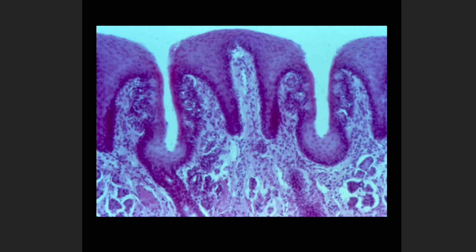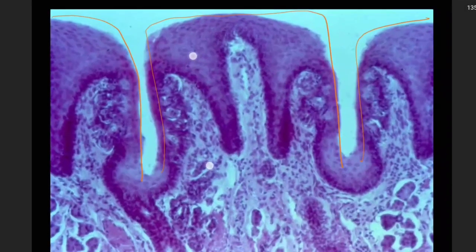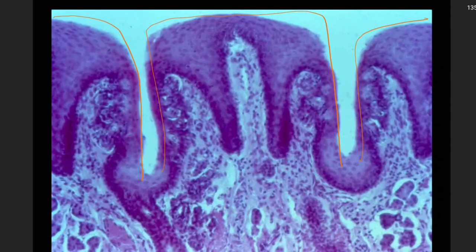Now this slide has been pulled directly from the modules. First, we want to identify our papilla. So we've got one papilla here. This whole thing is one papilla, and then we have a neighbor papilla. Once you do that, you want to look a little closer. And one thing to point out here is we're also dealing with a basement membrane. So if you're trying to find your taste buds and you're struggling, go ahead and look for this basement membrane.